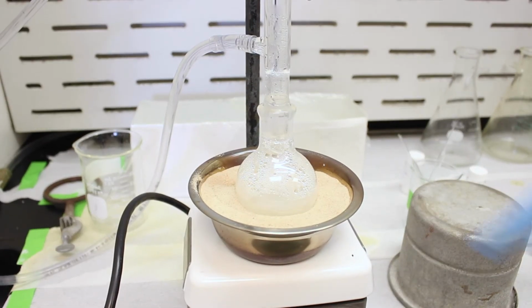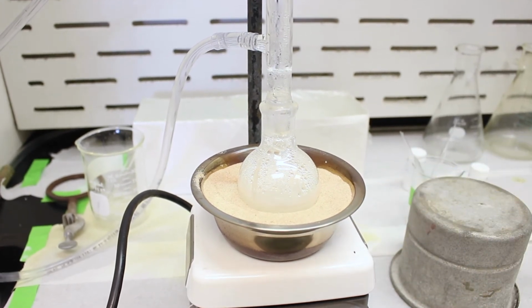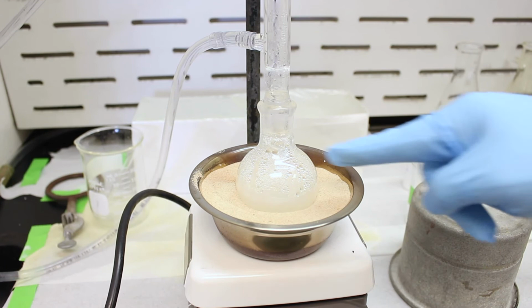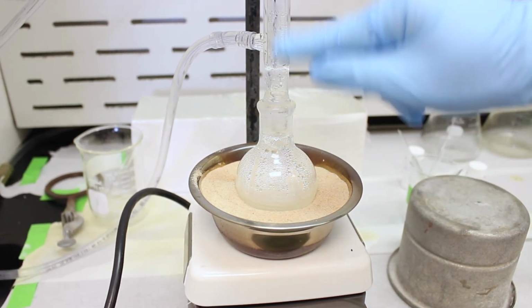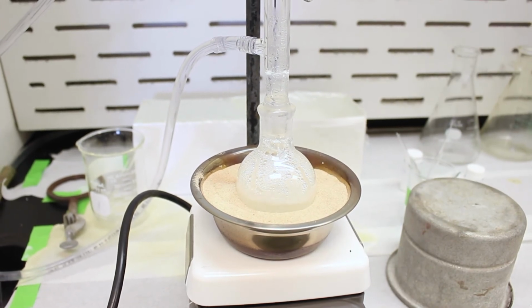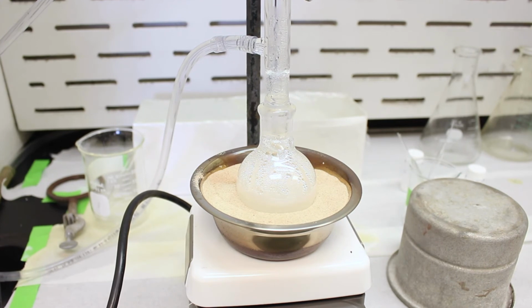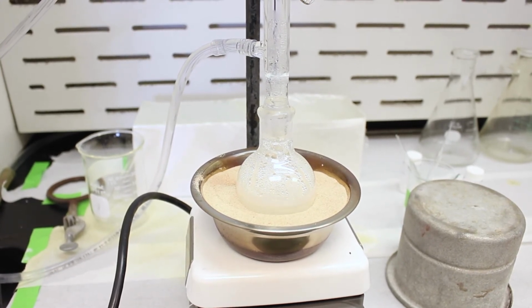Alright, so you'll notice that we've now reached a reflux. So inside the reaction mixture, the water is heated up to its boiling point, and you may see periodically some drops of water coming down from the condenser. And if you look up here, you can see condensation where the water is condensing. So now that the reaction is at high temperature, and it's probably occurring at a higher rate, let's talk a little bit about how water accomplishes this in spite of that.